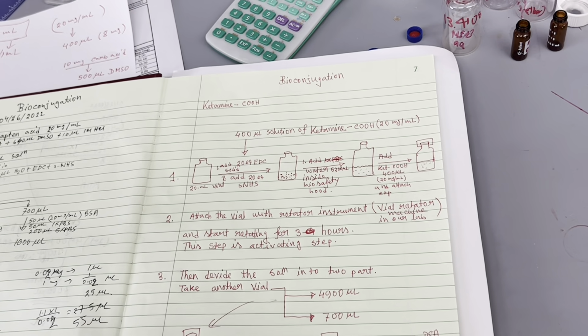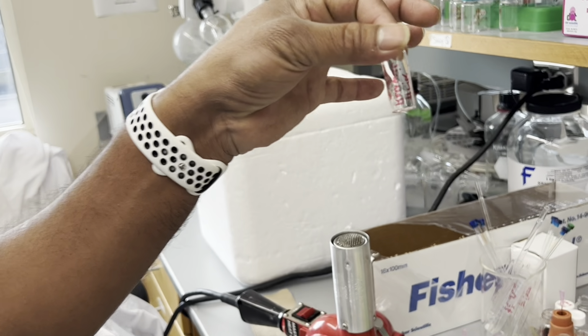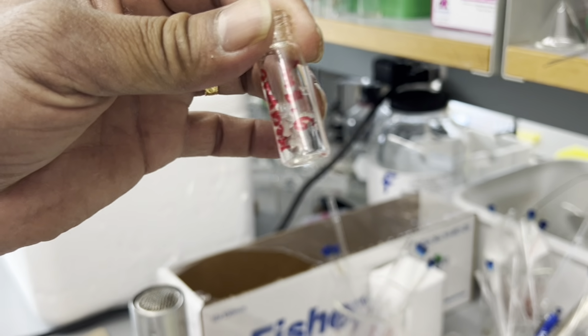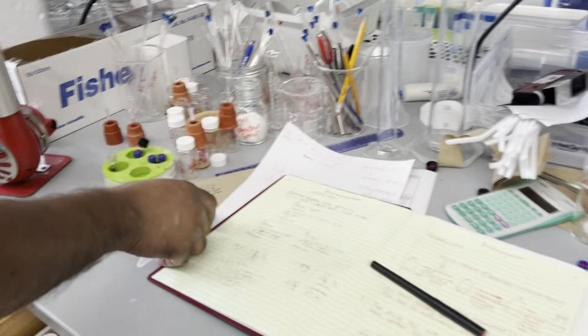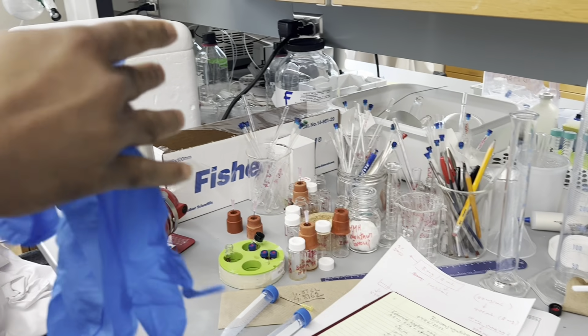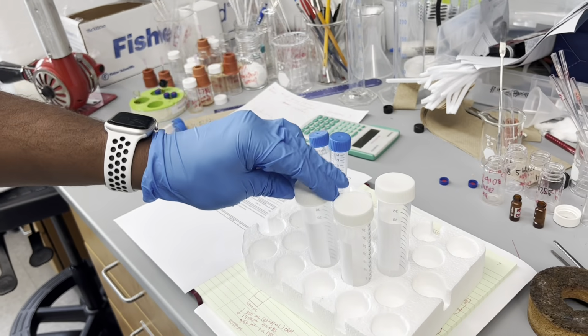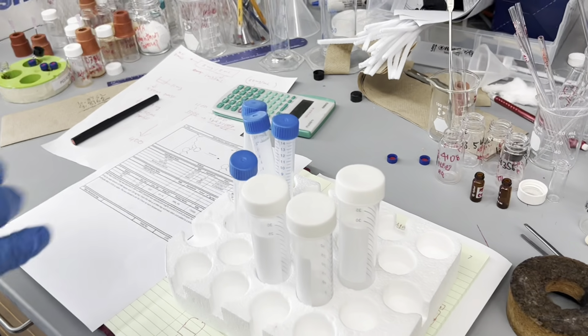So these are the calculation parts. Now we are going to start, and before starting, what are the things we need? We need the hapten acid. In a vial we measured it; you can see some solid here. We will need this falcon tube, and it's better to have everything ready before starting. So we are taking 3 falcon tubes, the bigger ones.